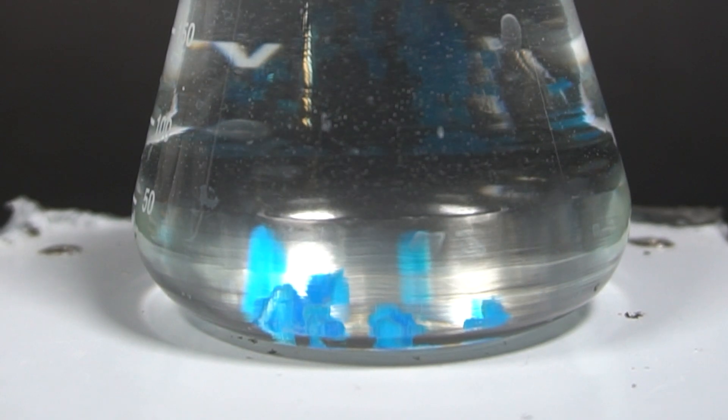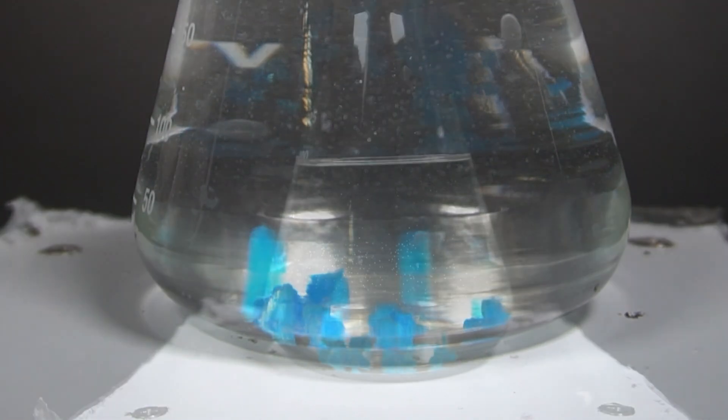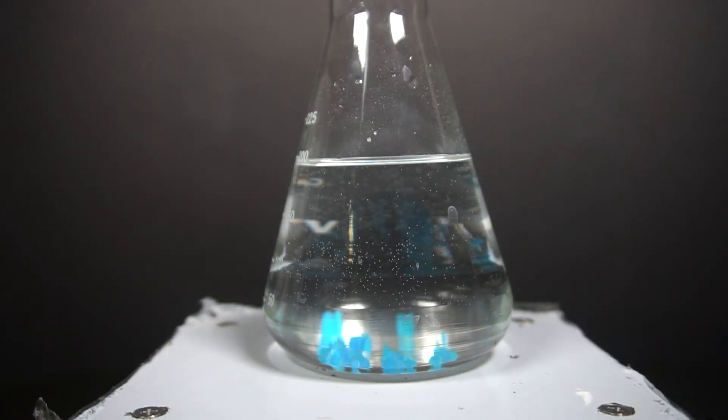Different metal salts react differently, and some people have even made some really cool art through this process. Anyway, that's all I have to say about sodium silicate, for now at least. I will be using it in a future project to create a water and fire resistant material, but that will be for another video.